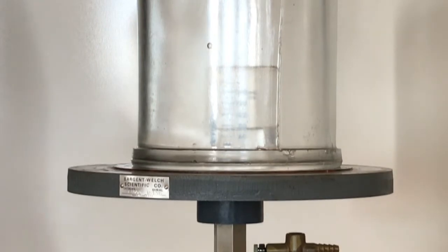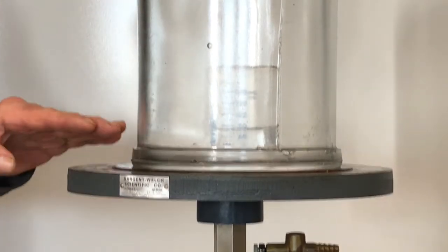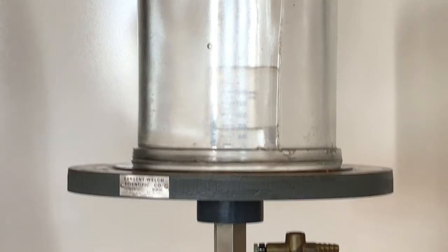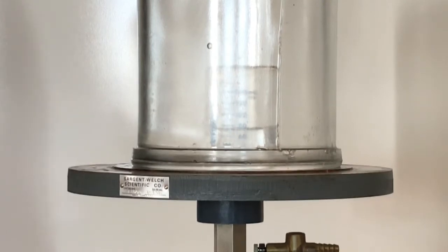So sort of like the water, the pressure is going down inside. And eventually here we'll start to see some bubbles form in the tert-butyl alcohol. And eventually here it should start to boil as much as the water did. I'm starting to see some bubbles now. So keep your eyes on it. The next thing that happens, happens quick.